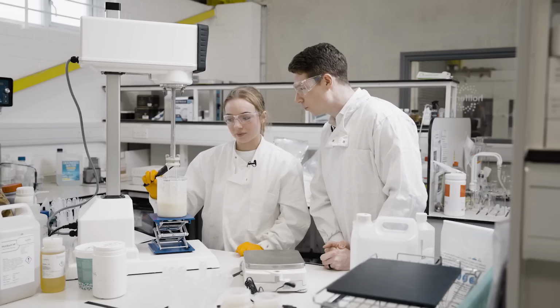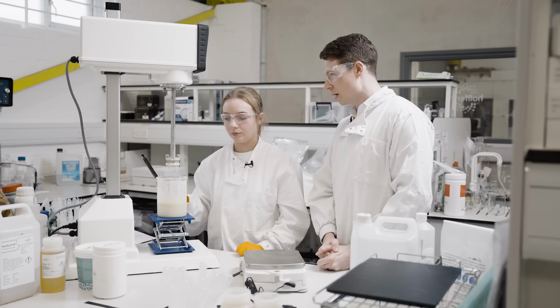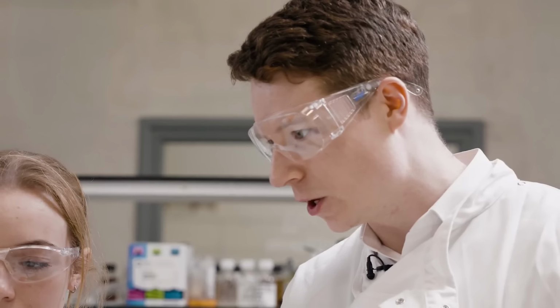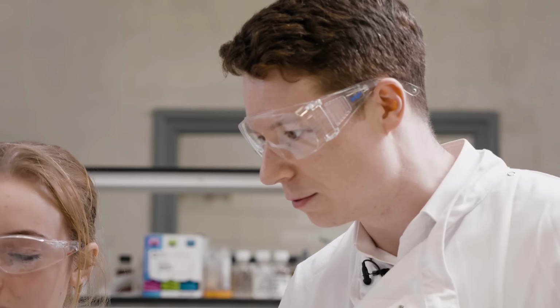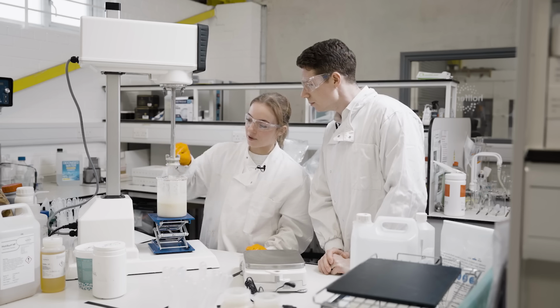And you know, formulations like that are very viscous would hold on to a lot of air, and it's just part of how that mixer picks up from the bottom of the container and avoids pulling in huge amounts of air from the surface that helps it maintain that without being full of bubbles. Yeah, and that's why I really like this head in particular for toothpastes. So yeah, you'll have to give it a try and give me some feedback. Definitely.